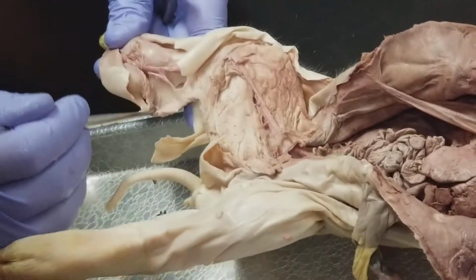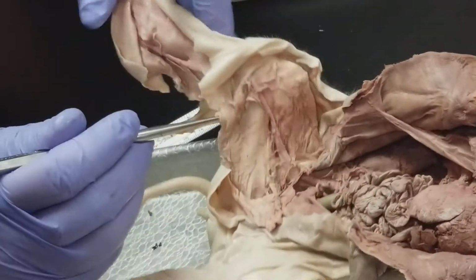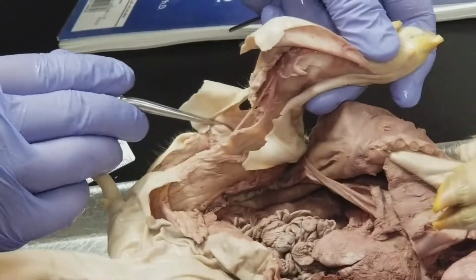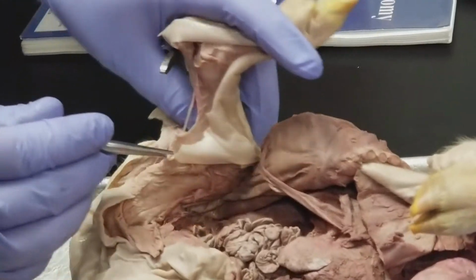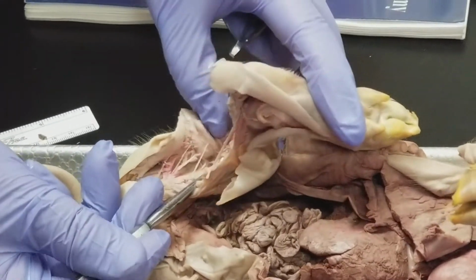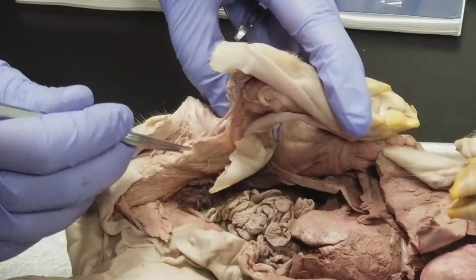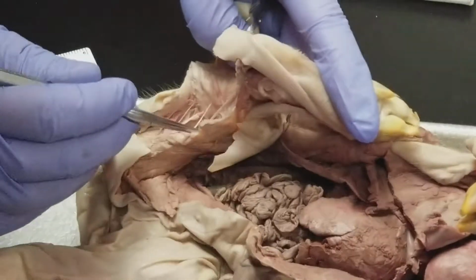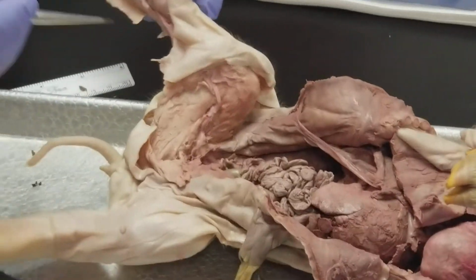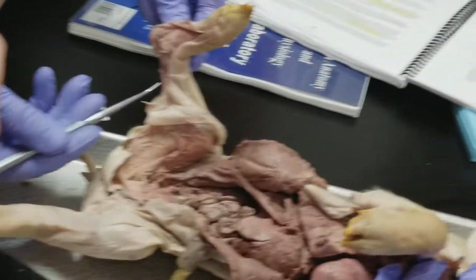Over here. Where did you go? That's pretty much it right up there, or close enough. And then it was very difficult to follow these guys as they came down.